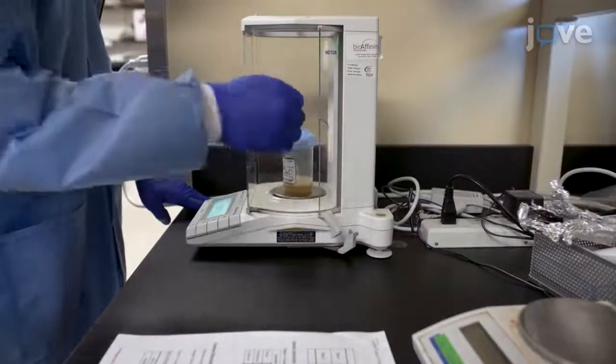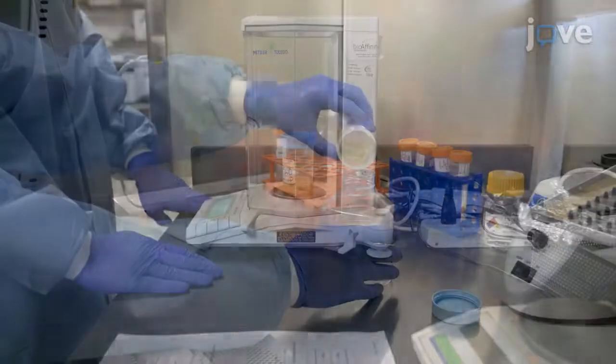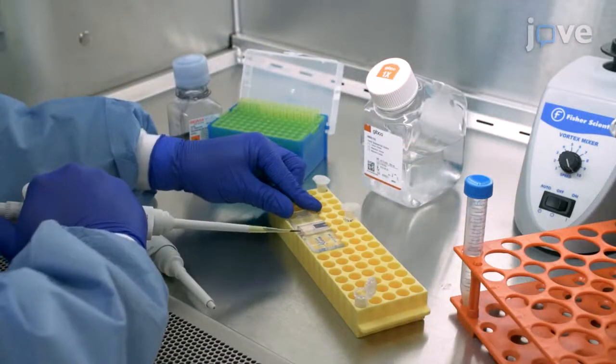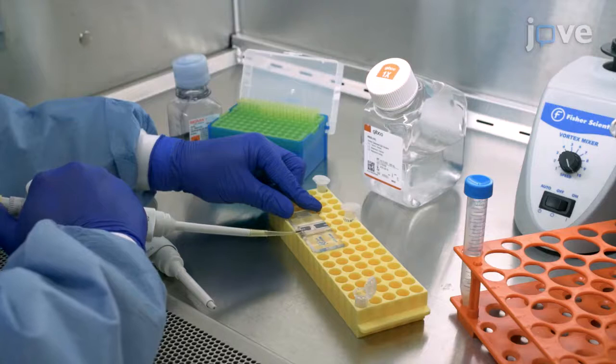This protocol resolves common challenges experienced with sputum processing that have made it difficult in the past to use with flow cytometry for high-throughput clinical diagnostic purposes. This protocol is designed to save time by using sputum weight to determine antibody and dye staining volumes. During the staining incubation, cell count can be performed for the downstream steps. It is important to achieve an accurate cell count to determine the correct resuspension volume to prevent any problems when running on the flow cytometer.